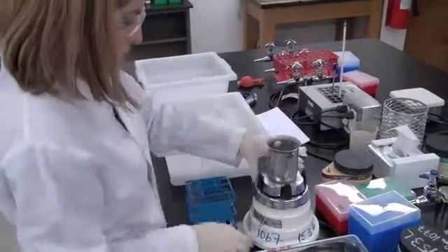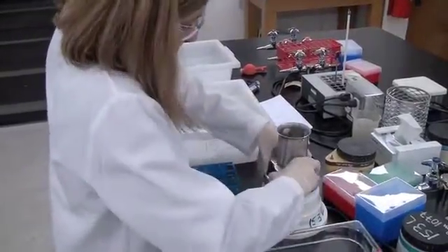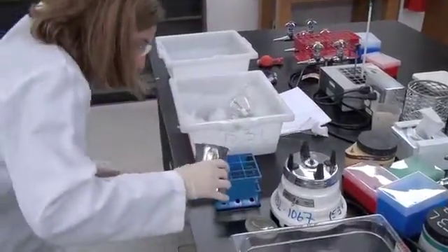Looks like Challenger Curate is not ready for blending. She's having a bit more trouble with the lids. Those lids are a little tricky. And you're back! Yes, and Challenger Curate has gained some time by blending 2 minutes straight, while Biochemist Dicer has taken twice as long with her intermittent bursts of blending.